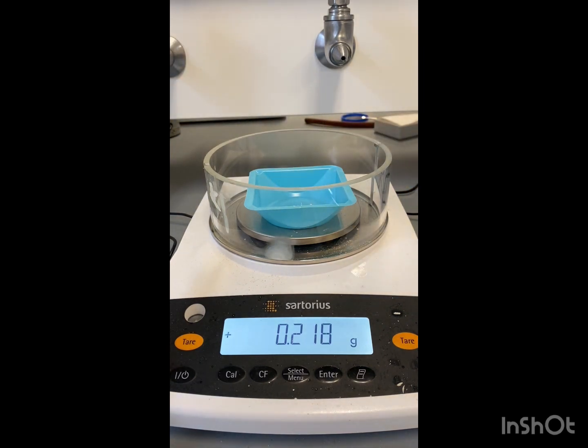All right, so we have a mass of 0.218 grams as our final mass. Or let's go with 0.219 grams as our final mass. And now we're going to go and get a melting point for our final product.